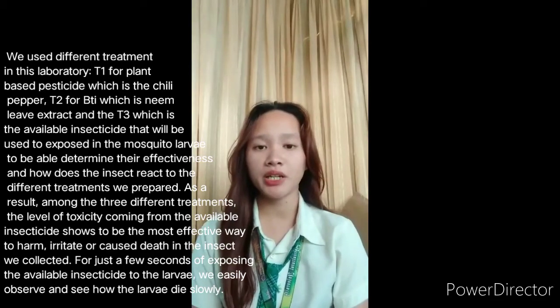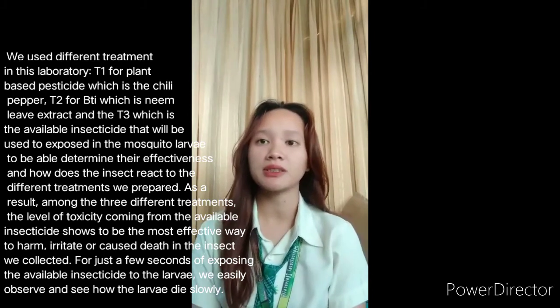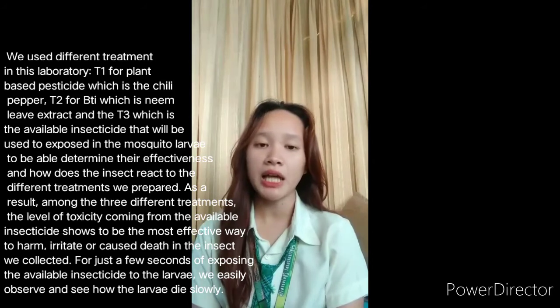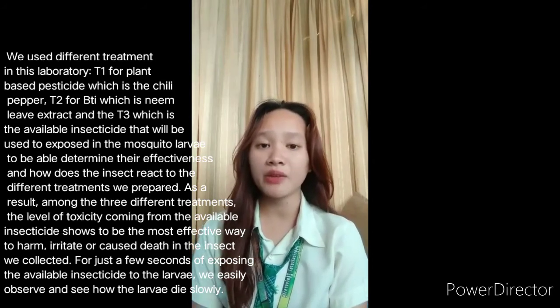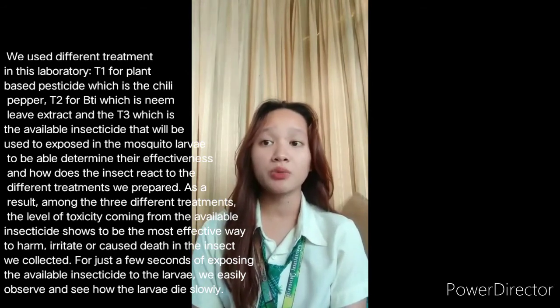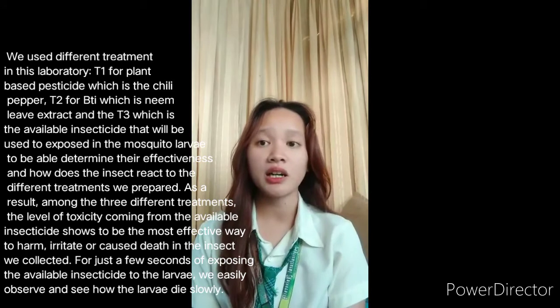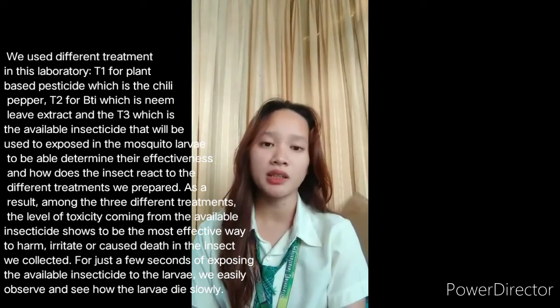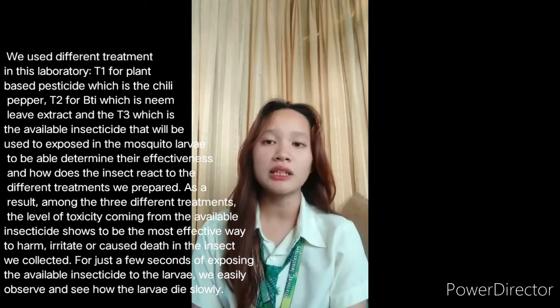In this laboratory, we prepared 3 different treatments. Treatment 1 is the plant-based pesticide, which is the chili pepper. Treatment 2 is BTI, which is the neem leaf extract. And treatment 3 is the available insecticide. These were used to expose the mosquito larvae to determine their effectiveness and observe how these insects react to the treatments we prepared.